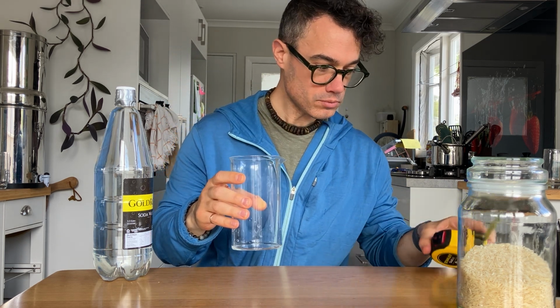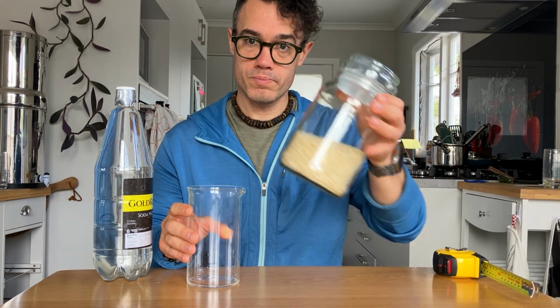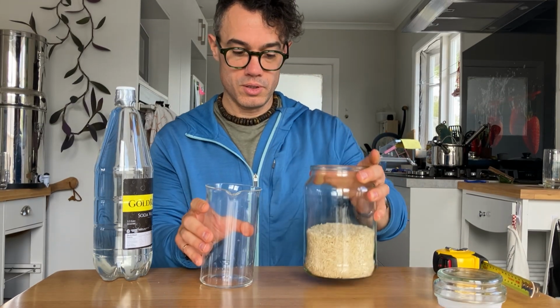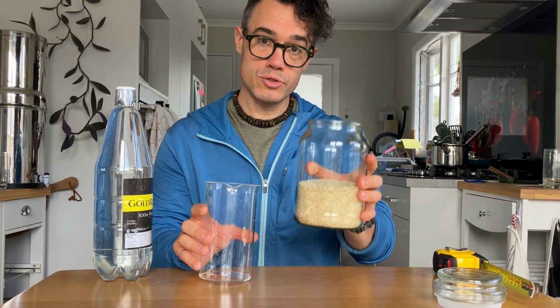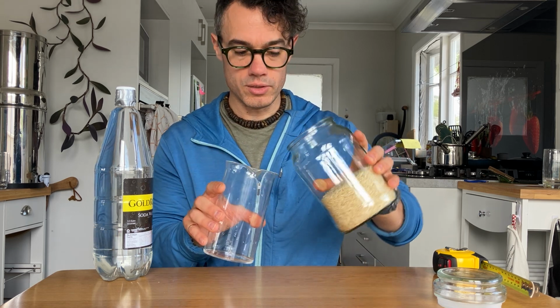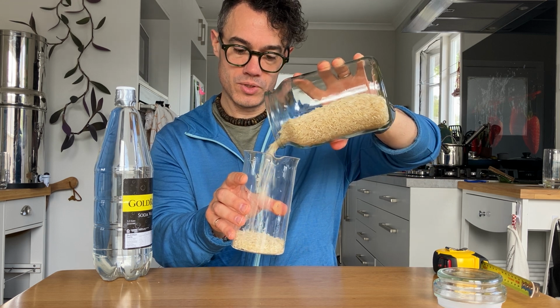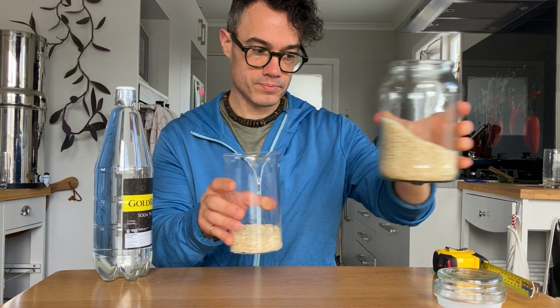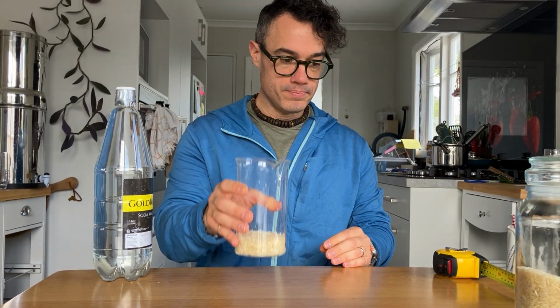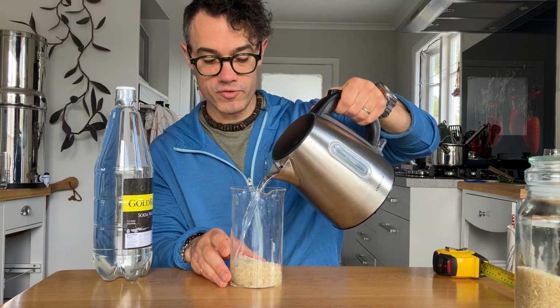millimeters. And we would then take our sediment, and so that's 82 millimeters as the full diameter, so we'd cut it in half to get the radius. So we take our sediment here, pour it in. We'd level it out. We'd also probably have some water from the river itself.